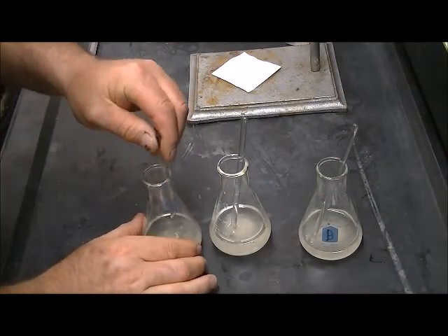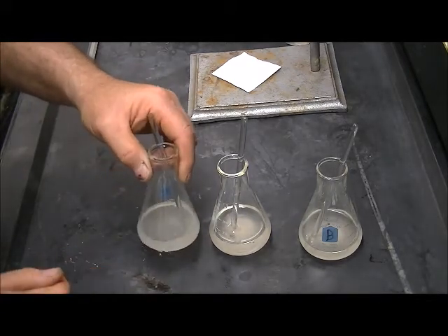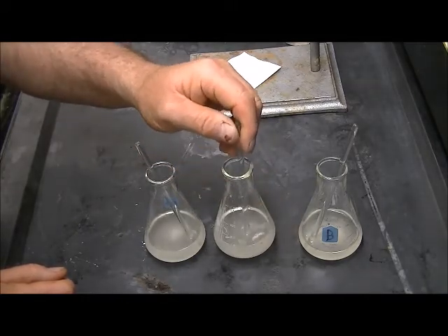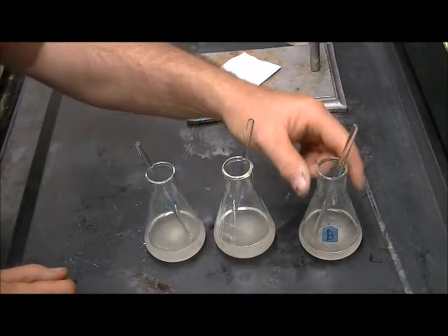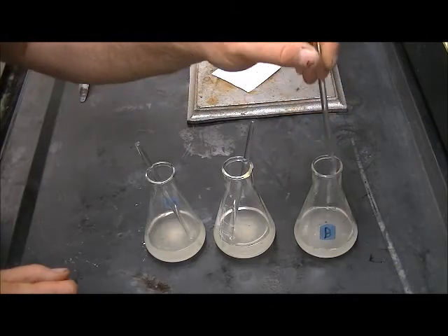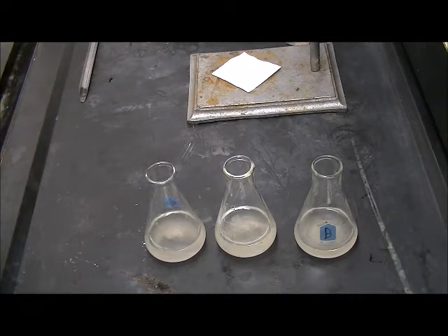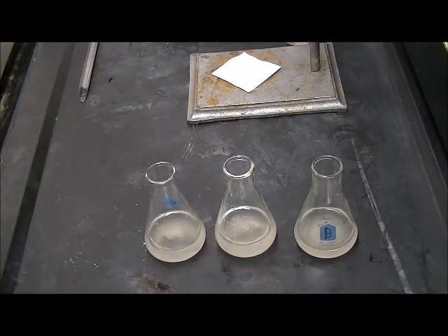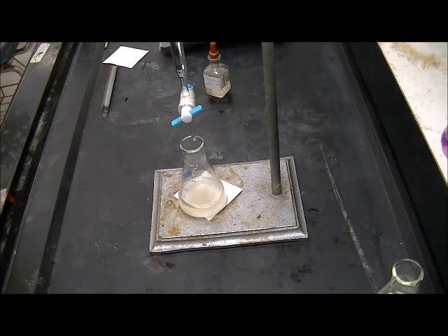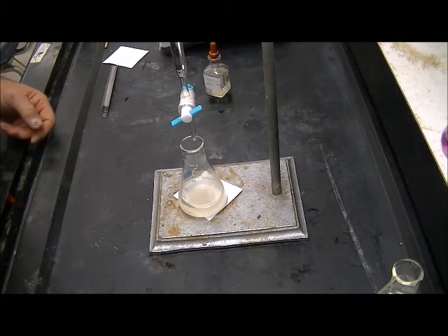I think we're just about broken up and ready to go. There is still some solid material in there, but it appears to be the binders. The bulk of the tablet is broken up and has been soaking in the water, so I believe the ascorbic acid has been released from those tablets. The burette has been refilled with the same titrant from the same bottle we used to titrate the potassium hydrogen phthalate.